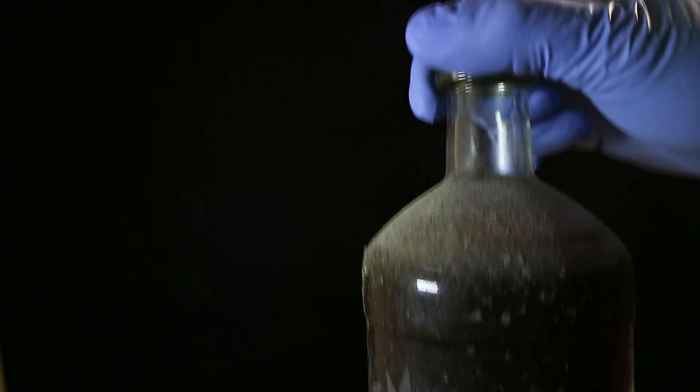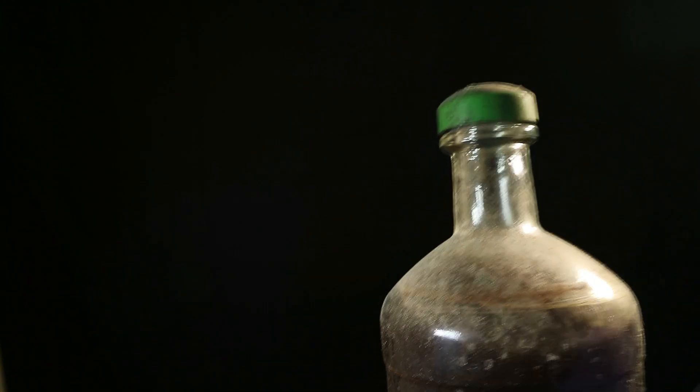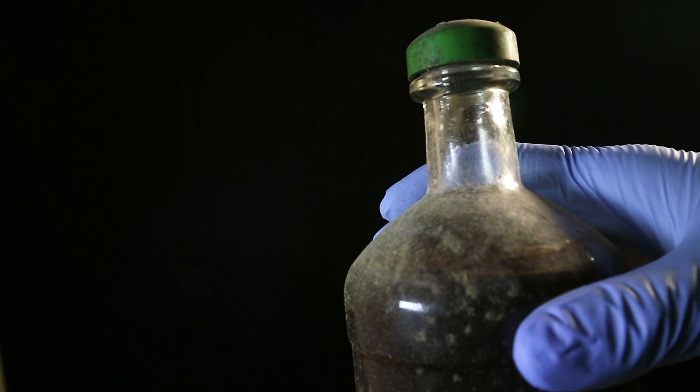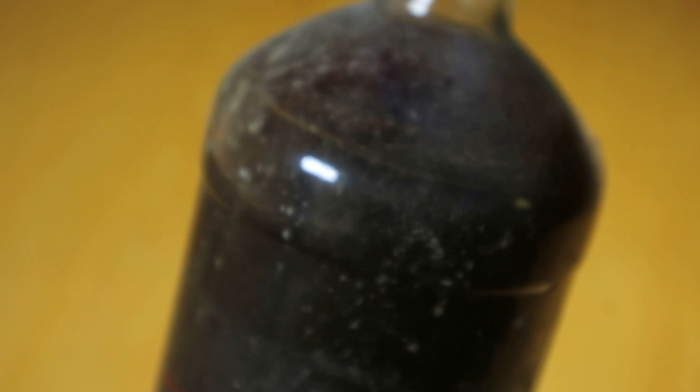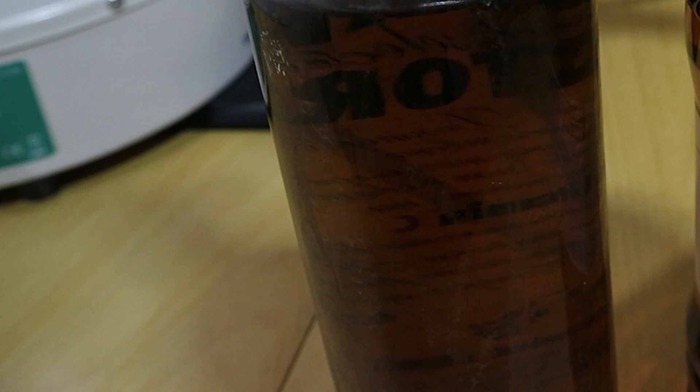Now I don't know what is the technical definition of moonshine in the 21st century but this here is basically just homemade alcohol that has been infused with some herbs in order to make it like healthy or something. The alcohol itself I believe is made out of grapes and this particular bottle I'm going to sacrifice and make pure ethanol solvent out of it.